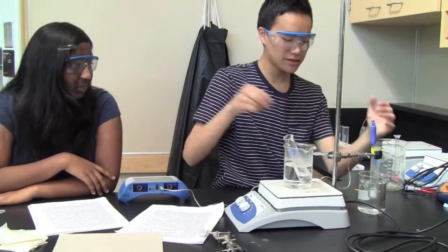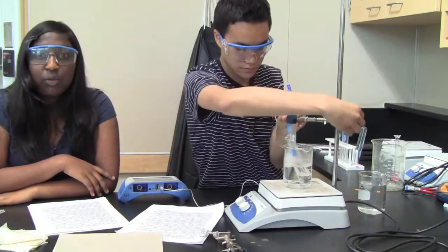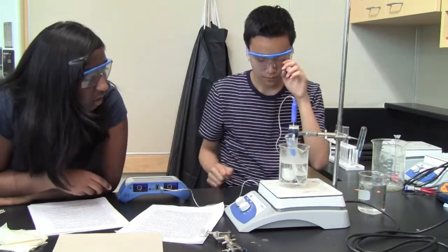You don't want to remove the temperature probe yet because it still has excess on it. Same thing as before. Carefully remove it. Now you just wait for it to melt, which will not take long if you have been keeping this in a warm solution.